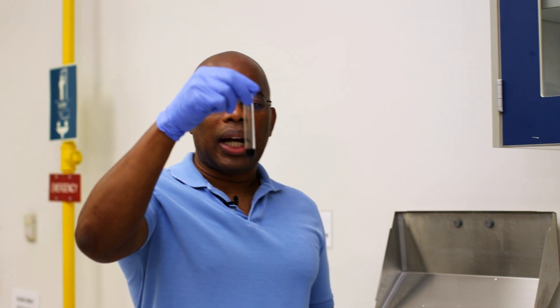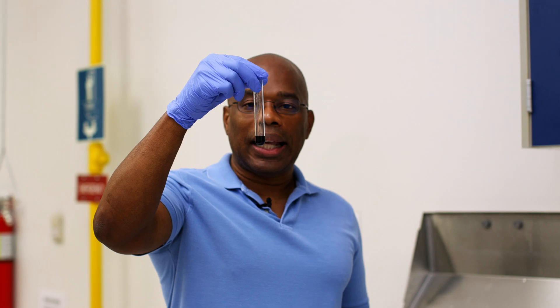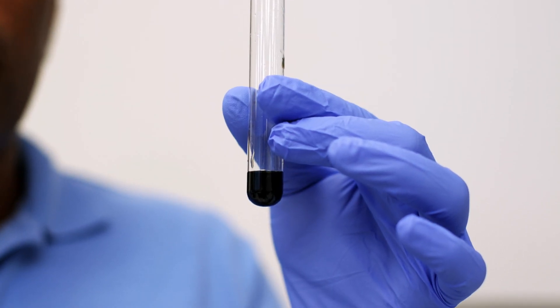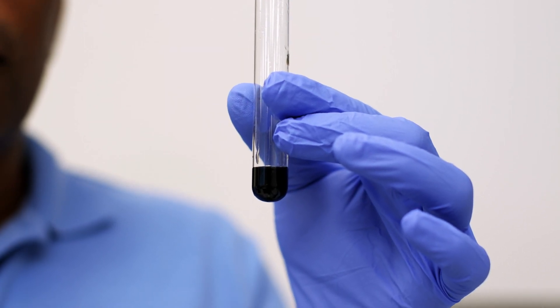Here you can see I immediately got a dark color. This is a dark purple, but it may appear black depending on how much starch is in solution. So this is a positive test — there is starch in this solution.